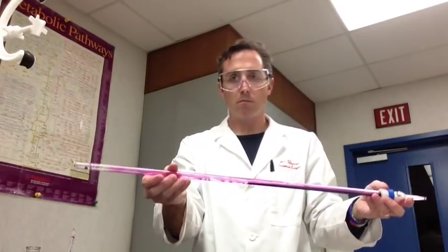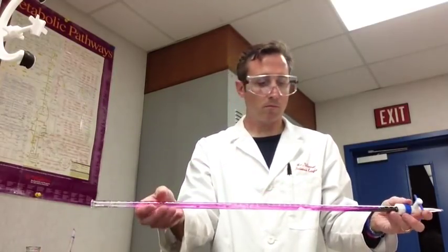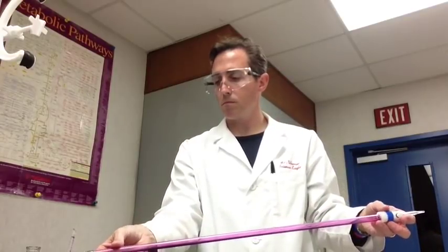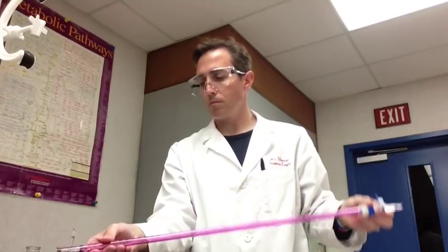It's washing out the impurities, it's washing out any water that might be affecting your concentration. You're going to gently roll it and make sure it coats the entire inside of the burette and then as you can see you're going to put it into the waste beaker which is the 250 milliliter beaker and you let it go out. Meanwhile the entire time the stopcock is closed.